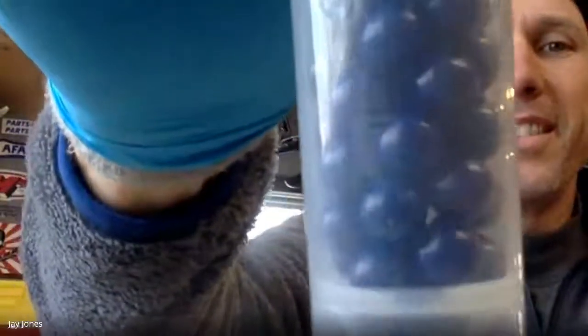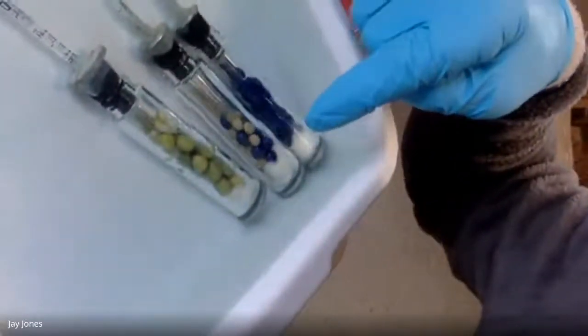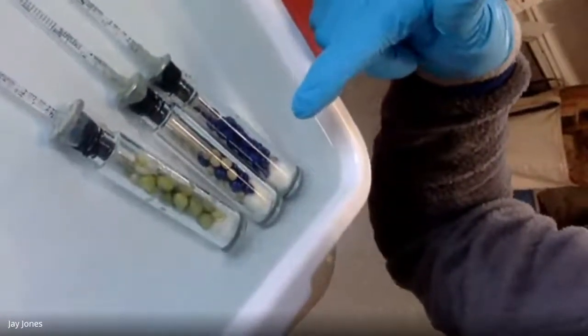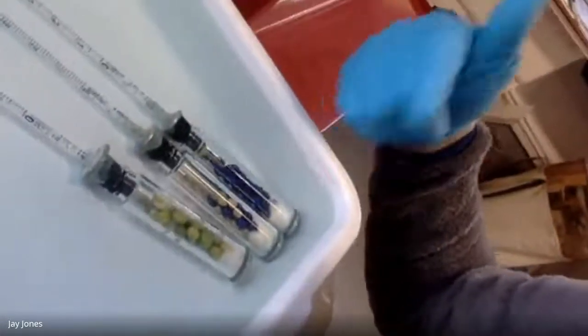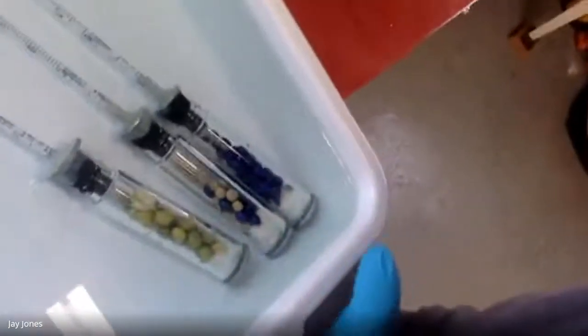Now, the beads. We know why we have beads in the middle chamber. We have beads in the middle chamber with the dry peas to take up the same volume as the germinating peas. My germinating pea volume is 10 mLs. That's kind of irrelevant. But I make sure that the volume in the middle vial, in the dry pea vial, that's also 10. And then, of course, the number of beads at the end occupies the same volume as the other two. So all the volumes are the same. But why do we even have a bead one, right? Let's talk about that in a second.